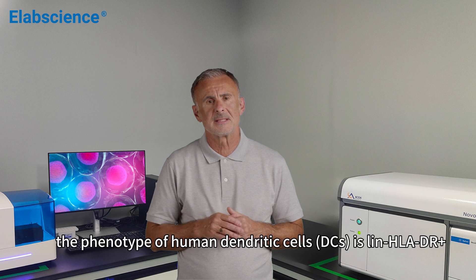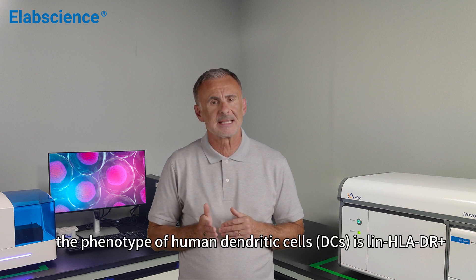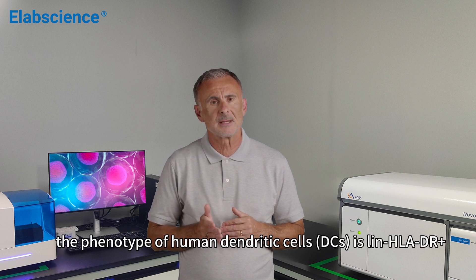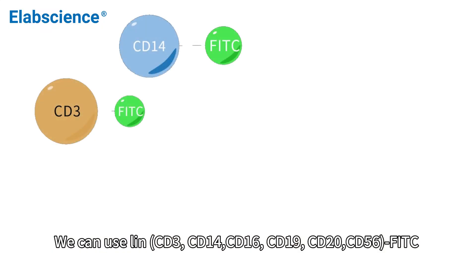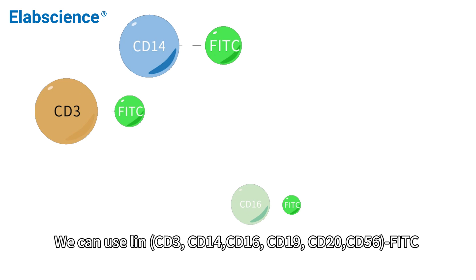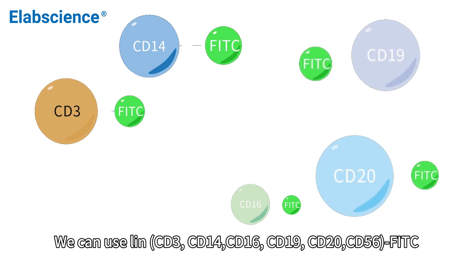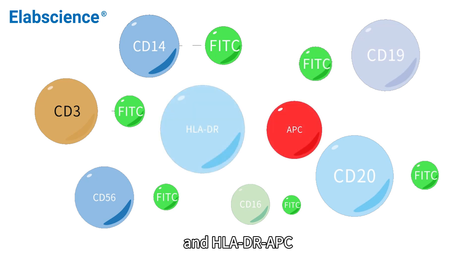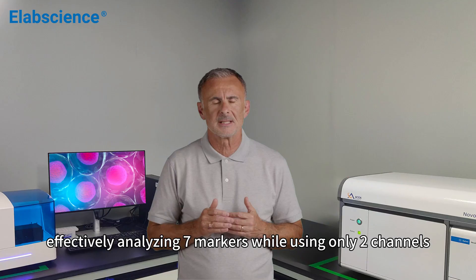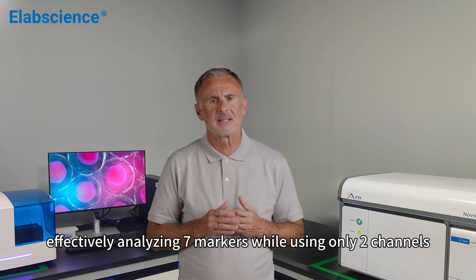For example, the phenotype of human dendritic cells (DCs) is LIN−HLA-DR+. We can use LIN comprising CD3, CD14, CD16, CD19, CD20, and CD56 conjugated to FITC, and HLA-DR conjugated to APC, effectively analyzing seven markers while using only two channels.